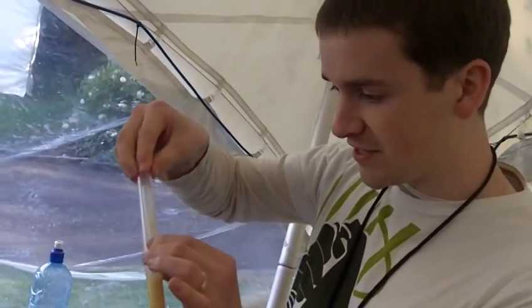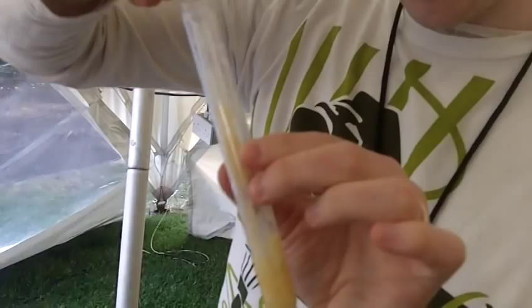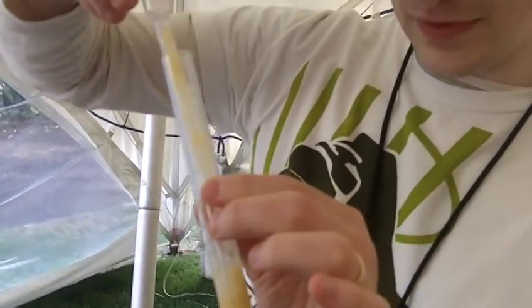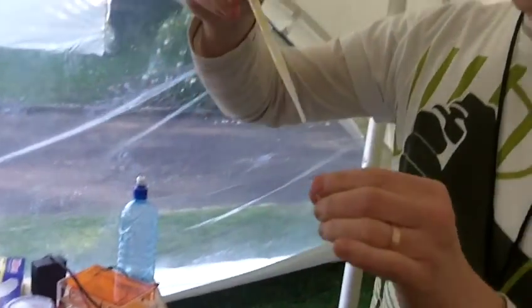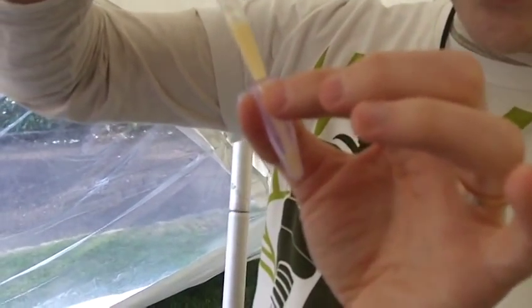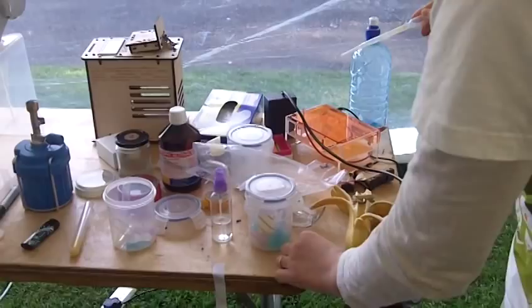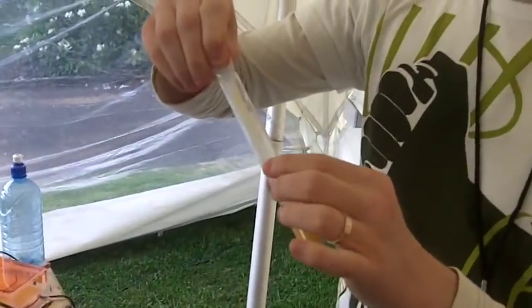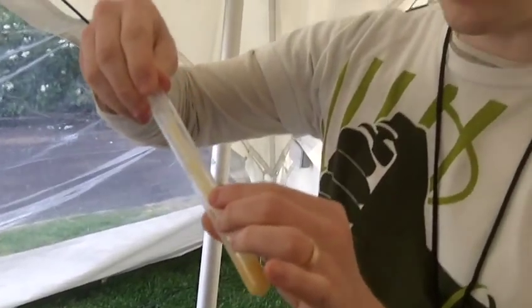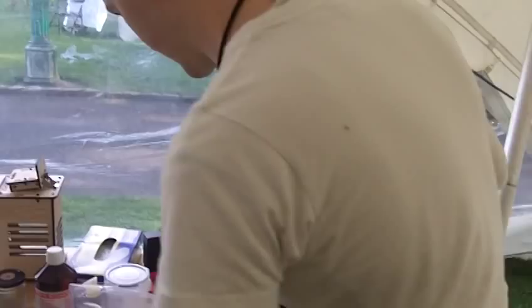I'm after mashing up a banana in a test tube, and I'm trying to get as much of this squishy banana up into this Pasteur pipette as I can. I'm going to put it into the centrifuge tube here, which is an industry-standard little tube — it holds about 1.5 millilitres of stuff. Banana paste isn't nearly as liquid as the alternatives. Most people go for strawberries or kiwis, but I couldn't find any at Mindfuelz, so we're doing bananas.